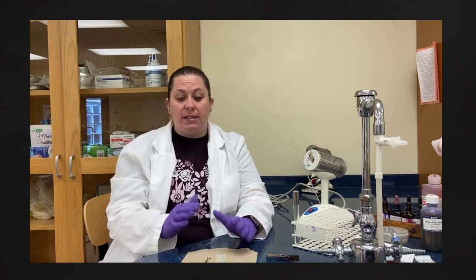Now we're going to get started on the staining process. When looking at the staining process, we're going to look at simple stains versus some of the differential stains.